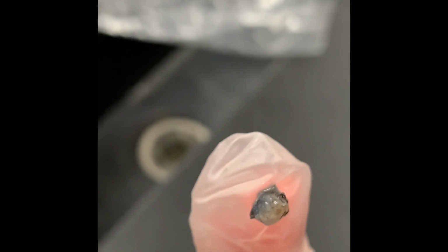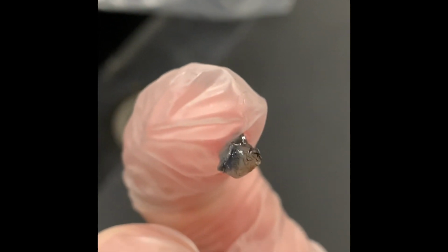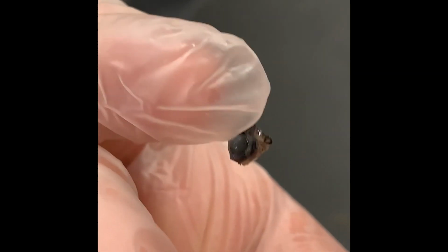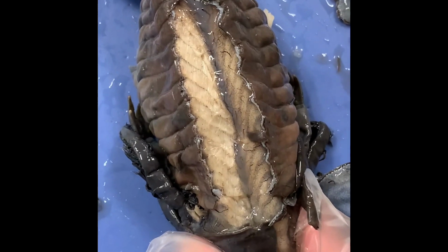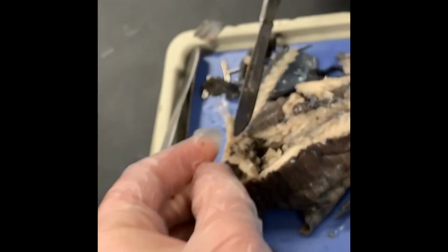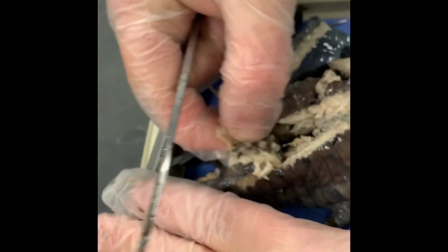Look at his eyeball. Right there. There it is. A really good close-up shot of it on my finger. There's his eyeball. There's his pupil, lens. So nice, so nice. Look at all that juicy meat. Hold on, let me focus it. That is prime to eat right there. I'll put that in the video. That'll be cool. Can you get in right there? Can you get a picture of that?